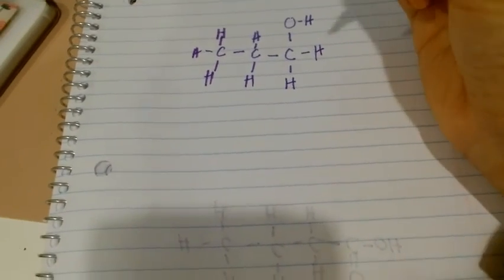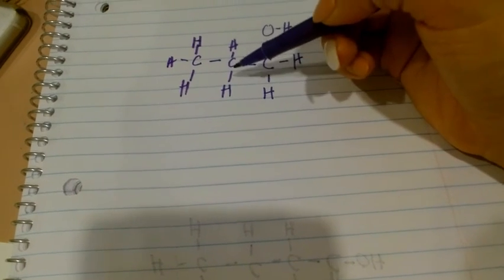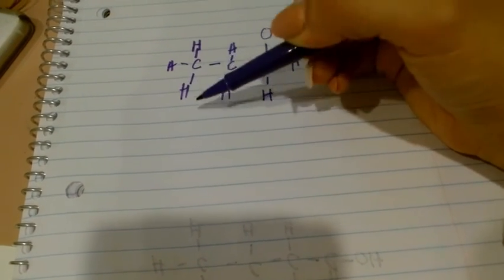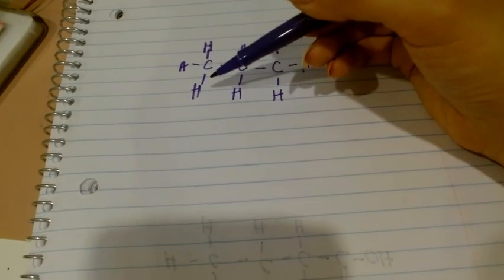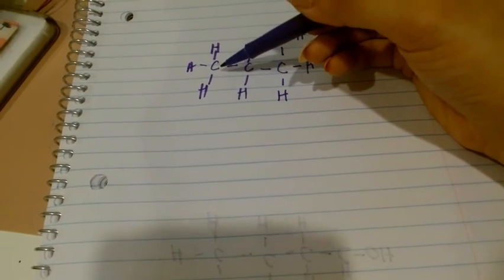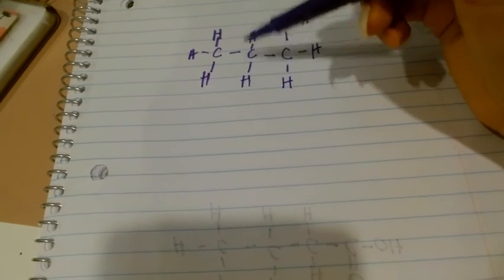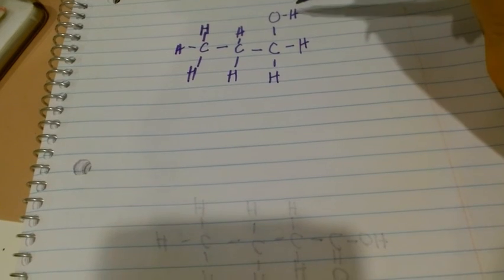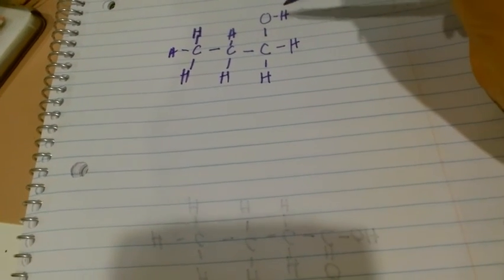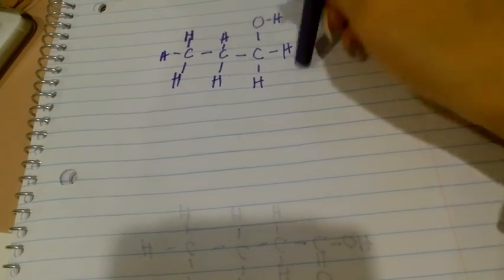Yeah, and this all works out because this CH2 right here is the CH2 that is a multiplet. It has 1, 2, 3, 4 neighbors. Wow, so many friends. This carbon over here is the CH3, and it is a triplet. It has two friends. So this all works out, and then we have the OH up here. This hydrogen's lonely, and this is the CH2 that is a triplet, but I already talked about it. Anyways, yes.